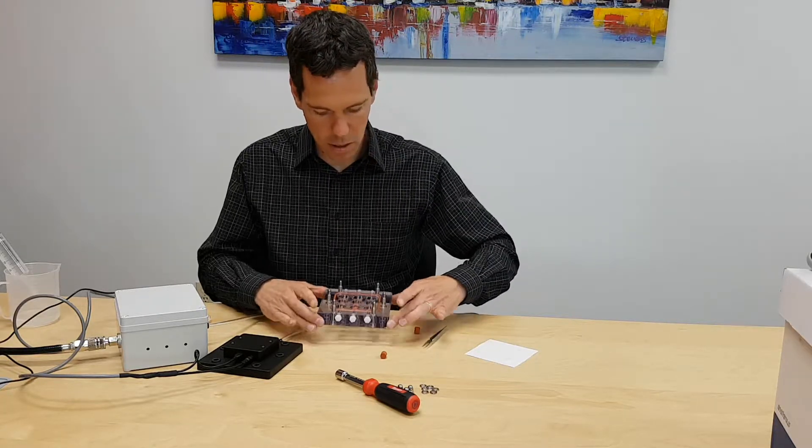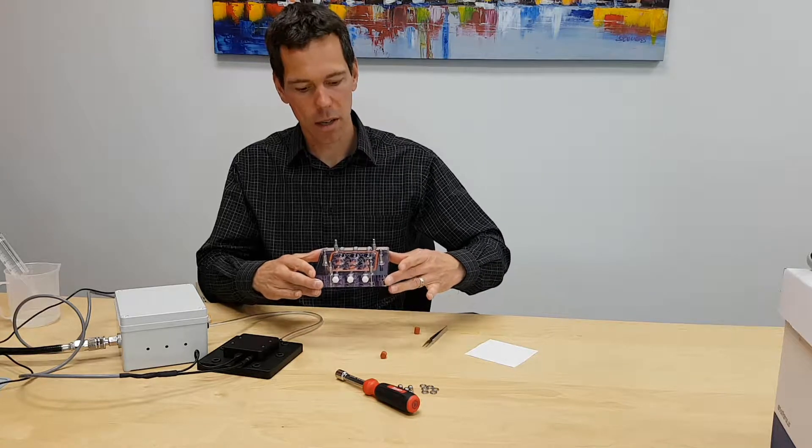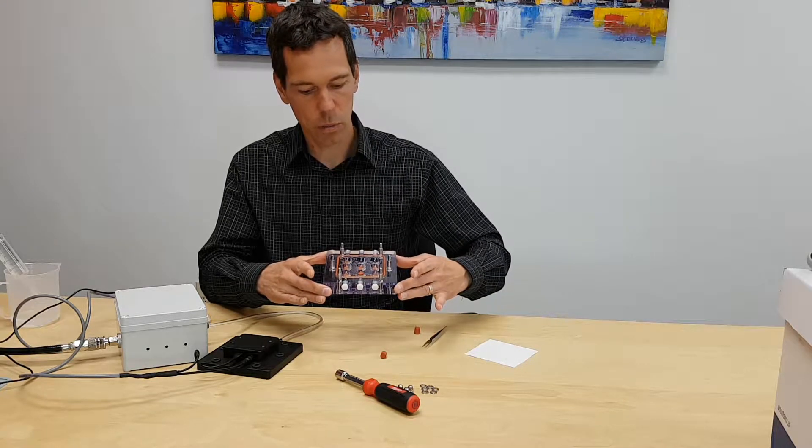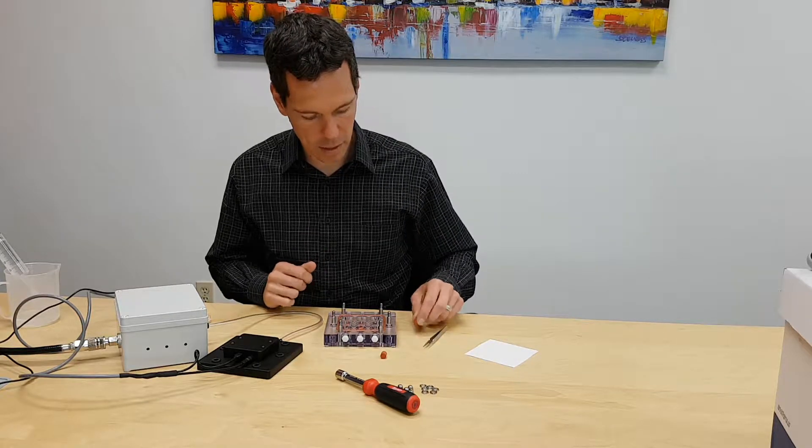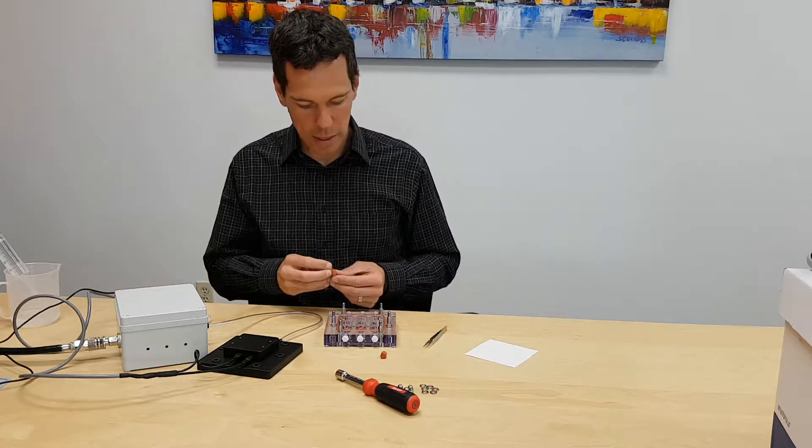I've got this TR system set up partially here. This is the 9-well culture plate, and I've got seven of the specimens in there. I'm just going to put the last two in the system.